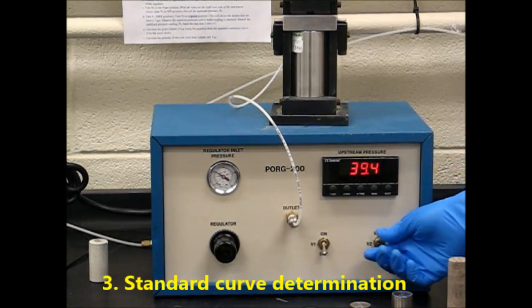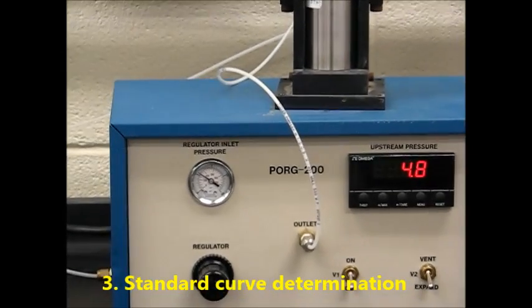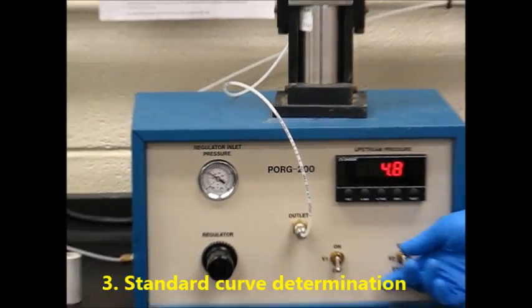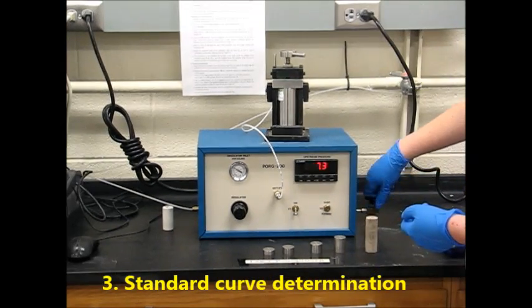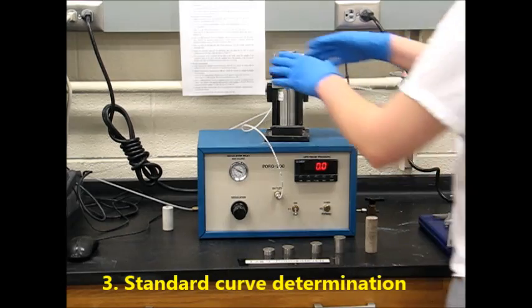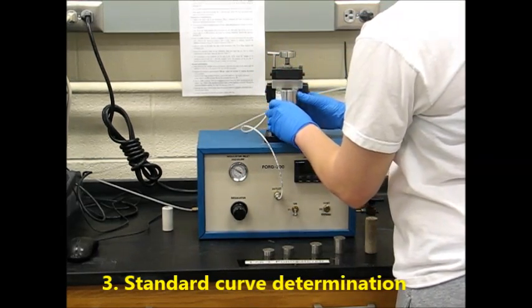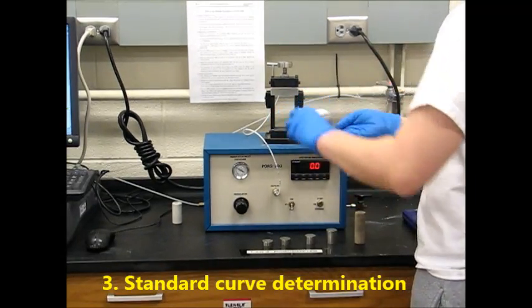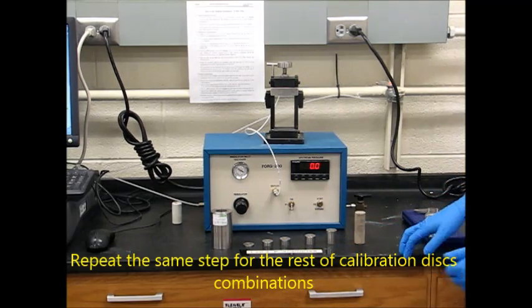Then we'll turn V1 to the off position and turn V2 to expand. Wait until the reading has stabilized and then record this as your P2. Then you'll turn V2 to vent, switch the valve on the back, open, and take out your sample. And we'll repeat this process with all the different sample sizes and a combination of them.